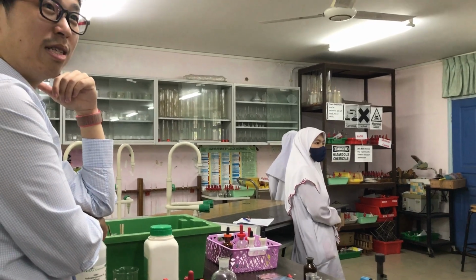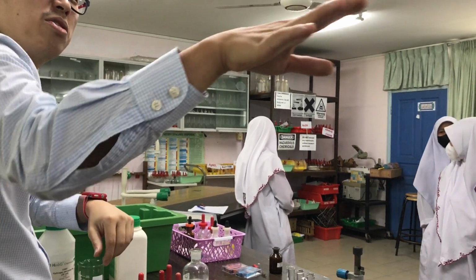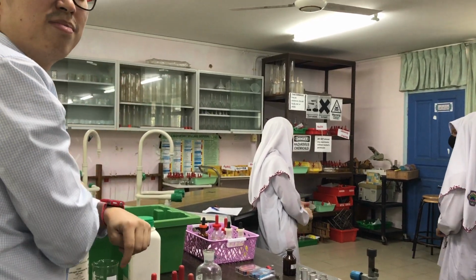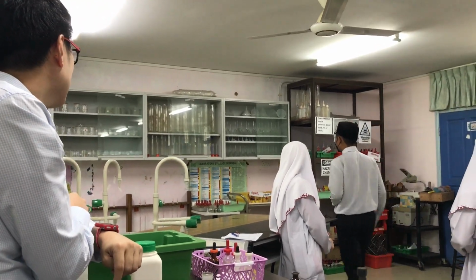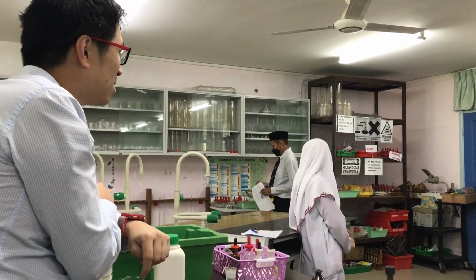Do you guys see the apparatus for filtration? It's okay, Daniel, just one. Go and help her. No, don't help him. Go and help her. Azira, where? Daniel, just one, where? I know, show me. This is your lab, right? Go and take it. What do you call that? What is that apparatus called?